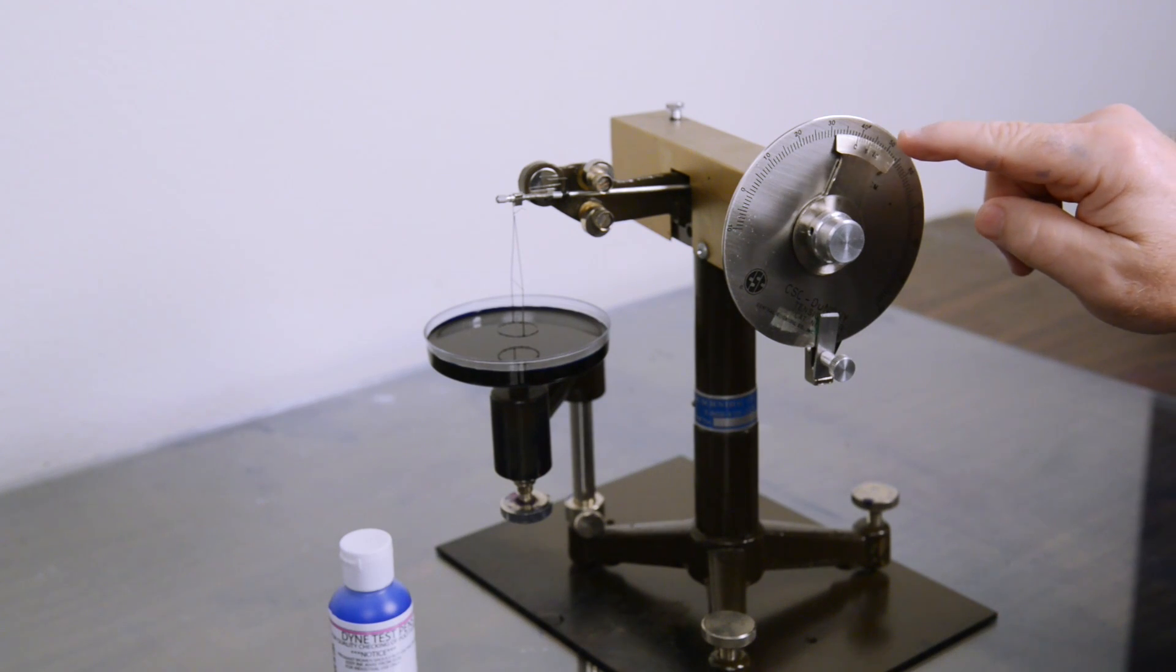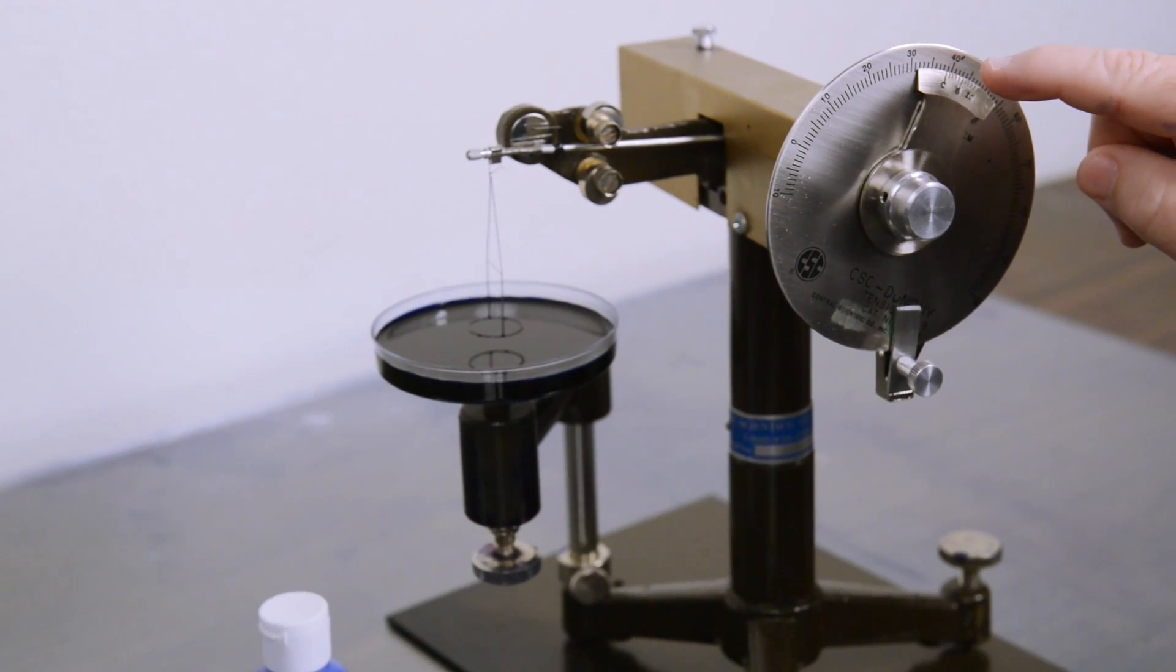It is showing at 39, which is one below, which is a 38, so we have an accurate solution.